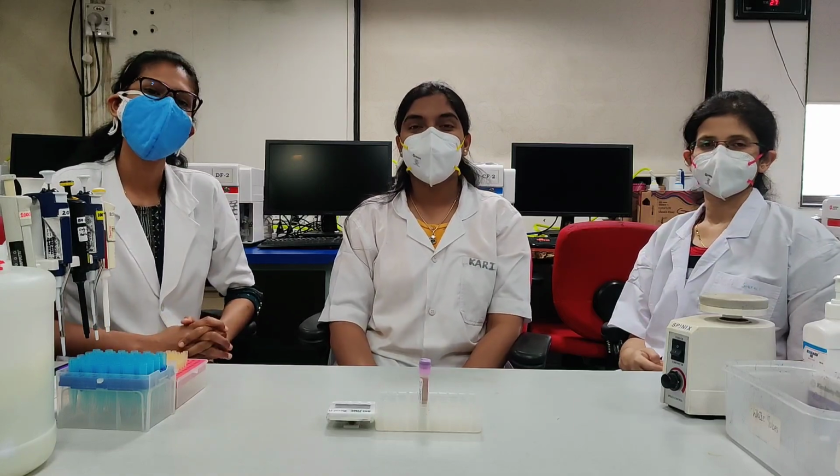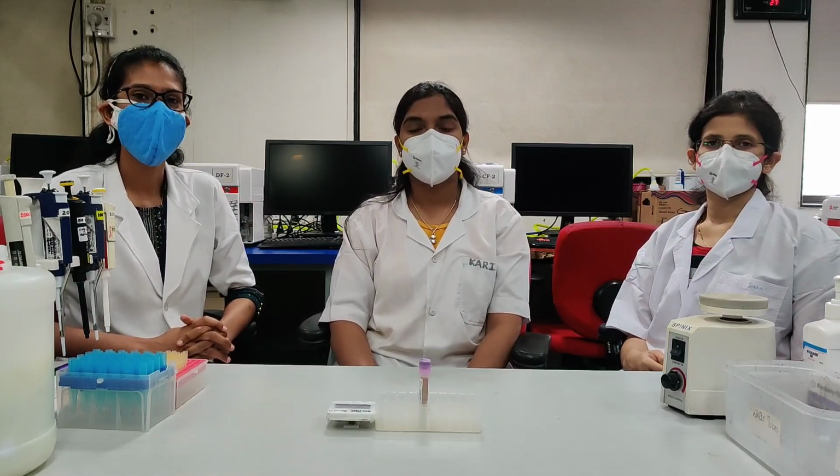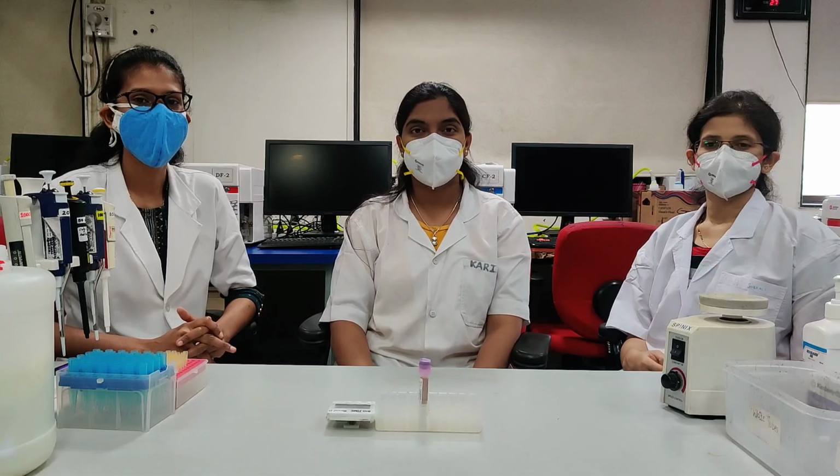Hello everyone. Today we will demonstrate sample processing for CD34 stem cell enumeration.